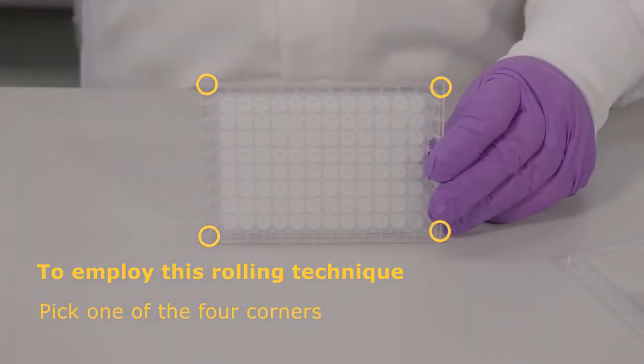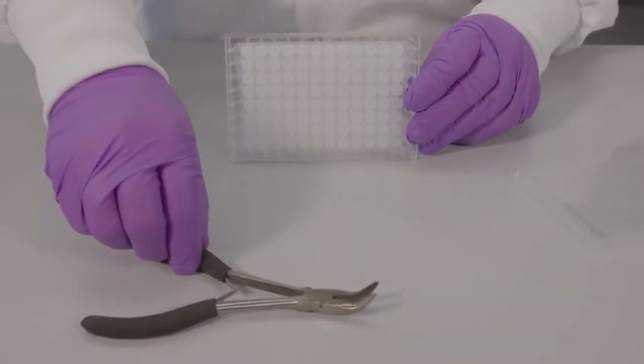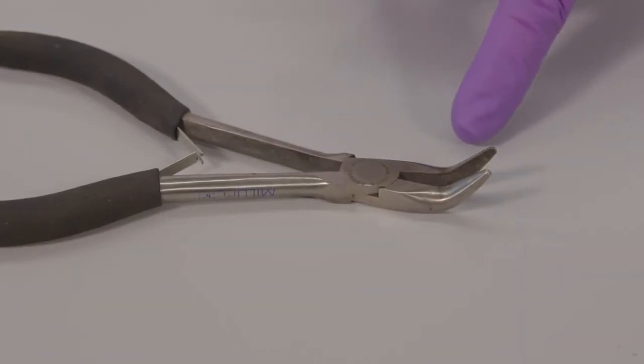The tools you'll need is a pair of long nose pliers with a curved nose bend of 90 degree angle.